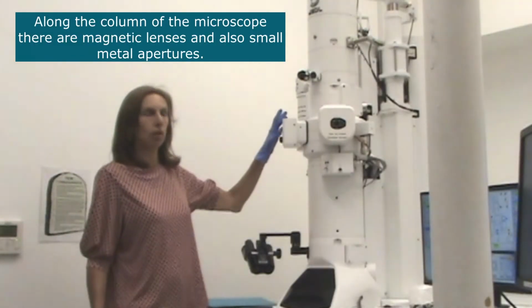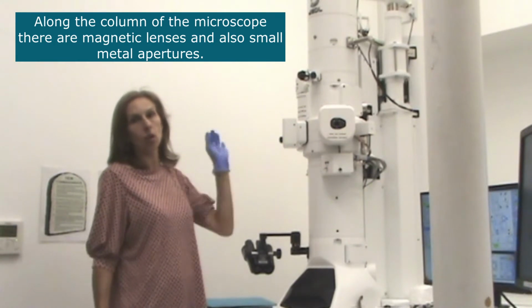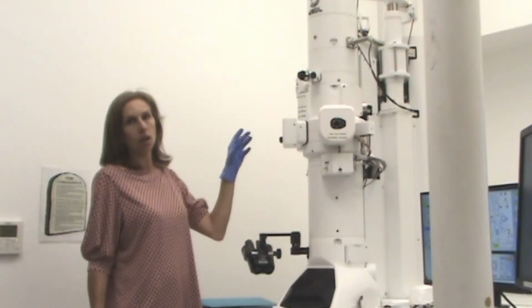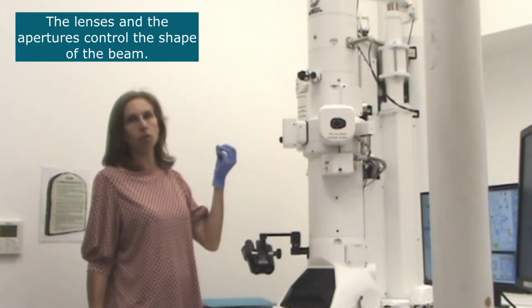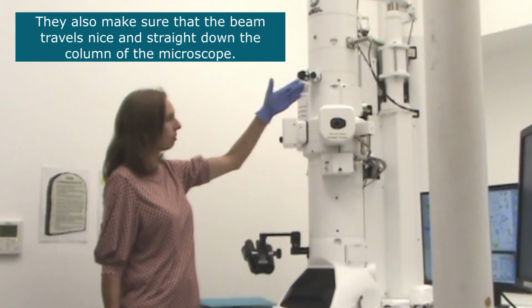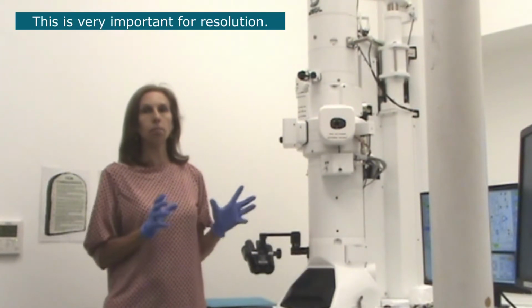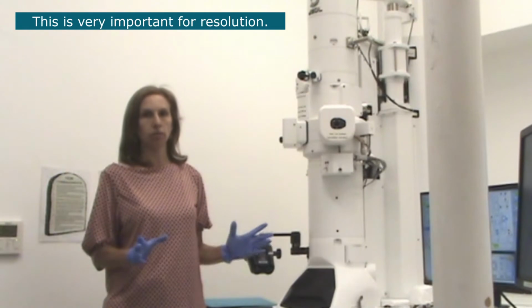Along the column of the microscope, here and here, there are magnetic lenses and also small metal apertures. The lenses and the apertures control the shape of the beam, and they make sure that the beam travels nice and straight down the column of the microscope. This is very important for resolution.